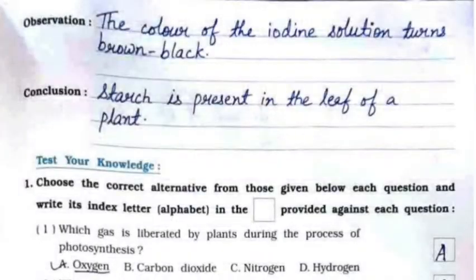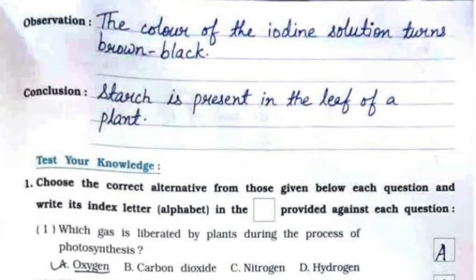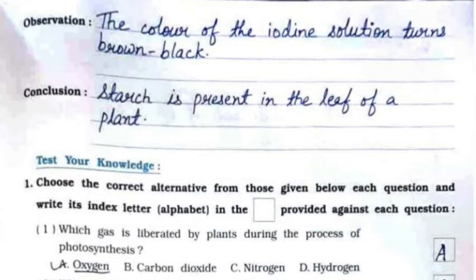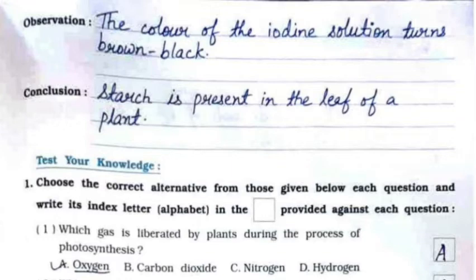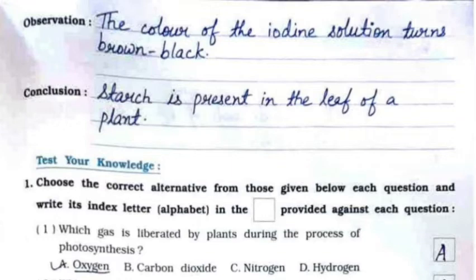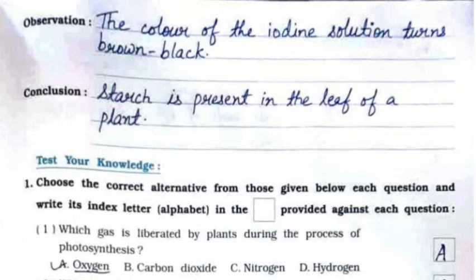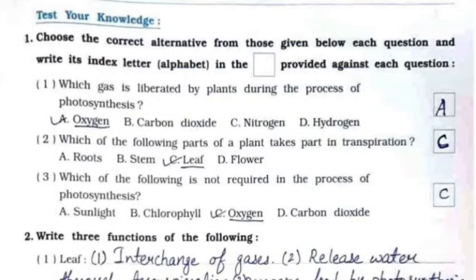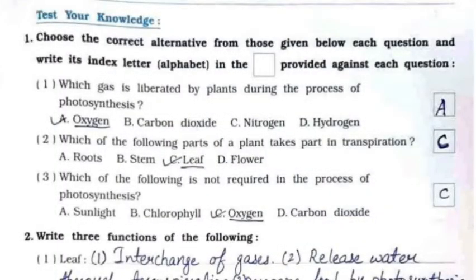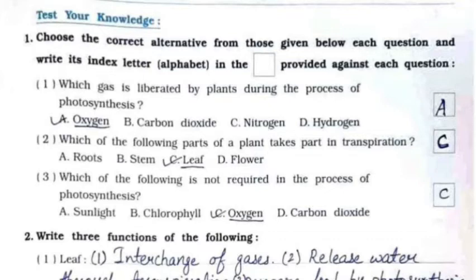The observation is: the color of the iodine solution turns brown-black. The conclusion is: starch is present in the leaf of a plant. Now, test your knowledge — question number one is MCQs.